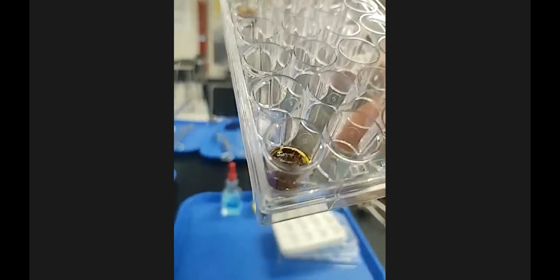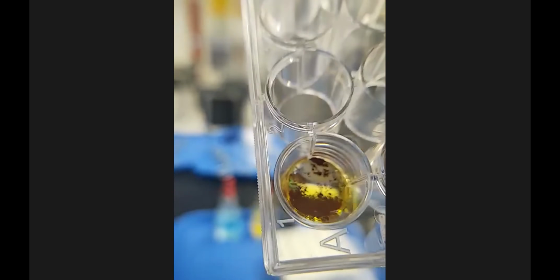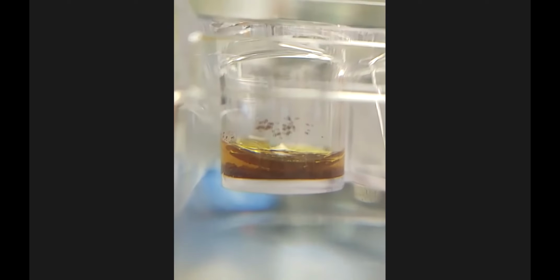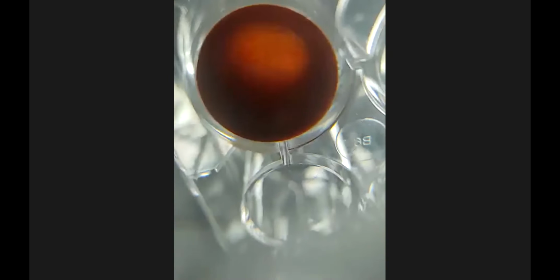Now there's a slight yellow hue to it, and I remember I did add a couple more drops, but still a thicker residue here, the chunks. And from the side, let me try and get a good view of the layers there. And then let me tilt my phone up so you can see the bottom view. All right. Kind of grainy.